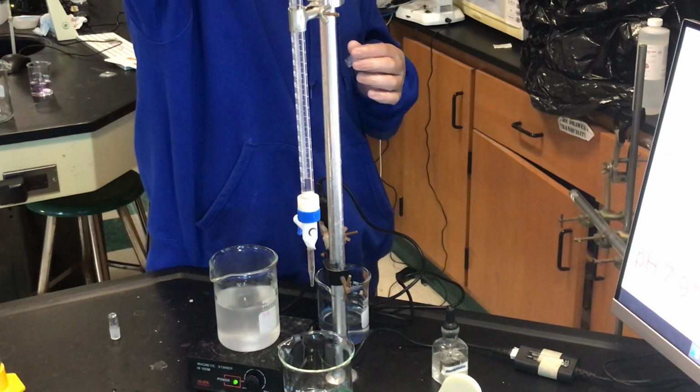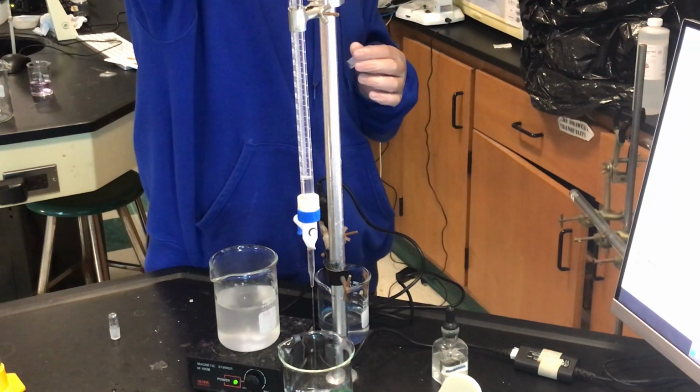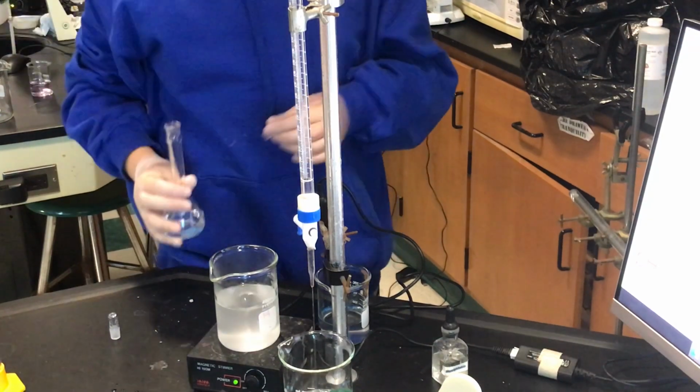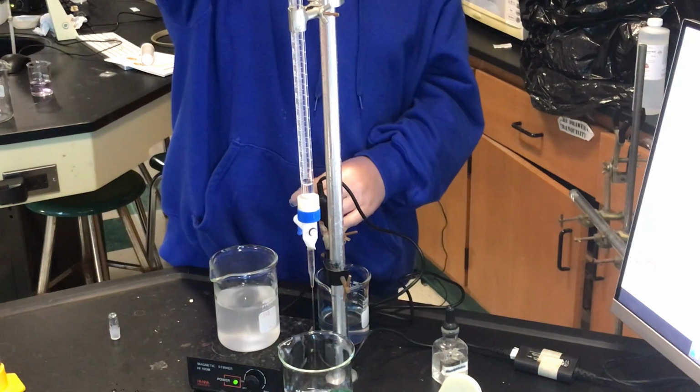We have more than enough. We only need 25 of it. A little bit more. A little more. All right, good. Good? Yeah, is it opening? Yeah, now it's opening. Oh, all right. Give me some more, because I think we didn't wash the sides, a little more aggressive.